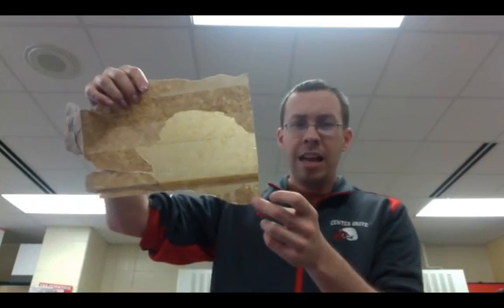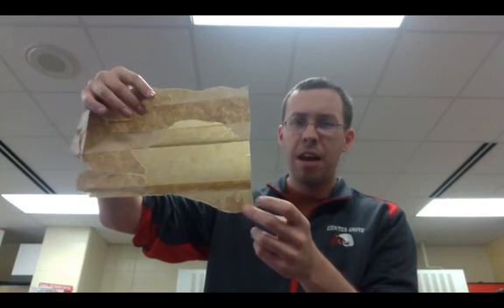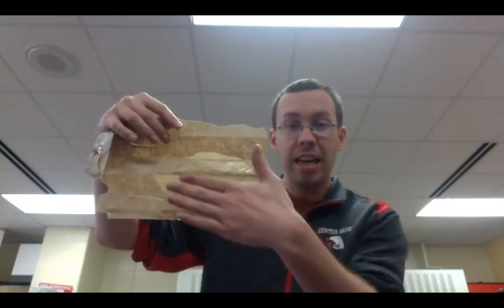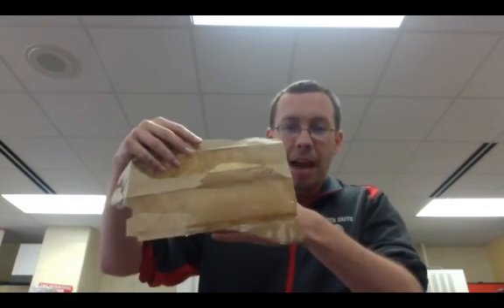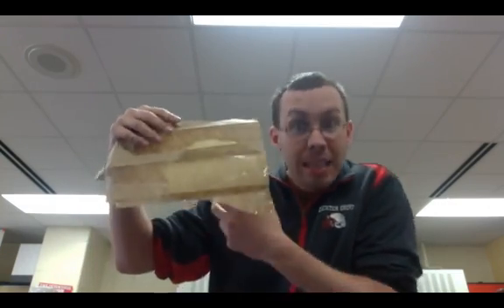Using the brown paper bag, you should be able to see — and you can actually see that really well — how you can kind of see through it a little bit better. This is the regular brown paper bag and this is the one that has the lipid on it. You can see my hand through the brown paper bag. That tells me that that's a positive test for lipids — the brown paper bag test. So if you can see through it, then it is a positive test.